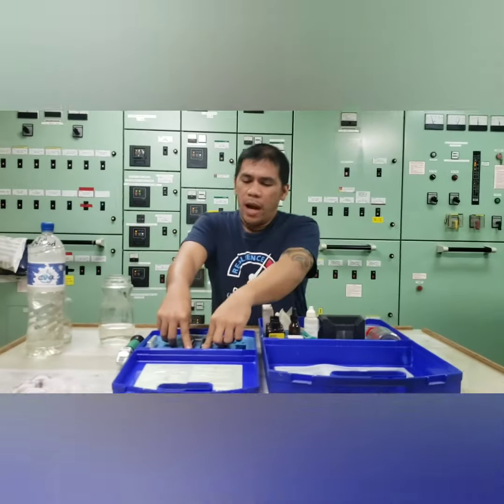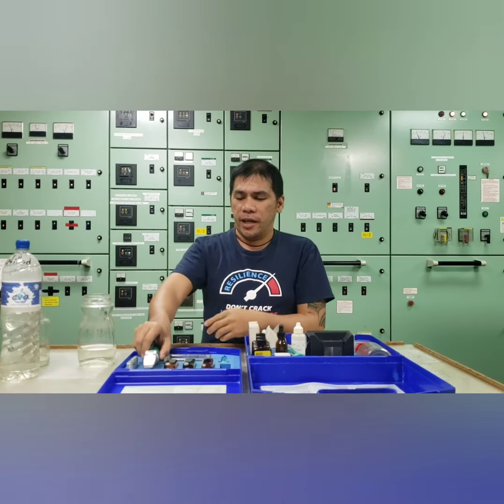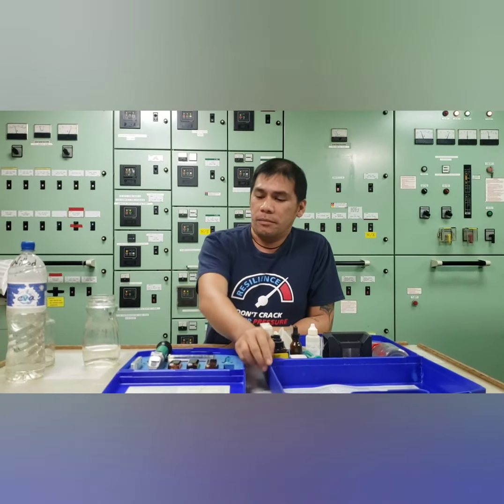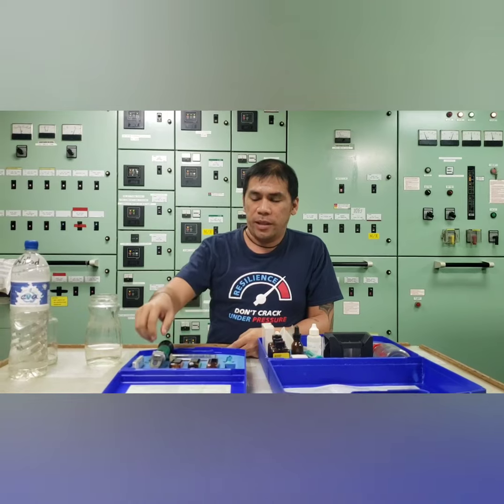So for this time, why we have to get the water analysis to determine the nitrite content of your jacket cooling? So what is the importance of this test in your jacket cooling system? Why we have to test the nitrite content of the jacket cooling?